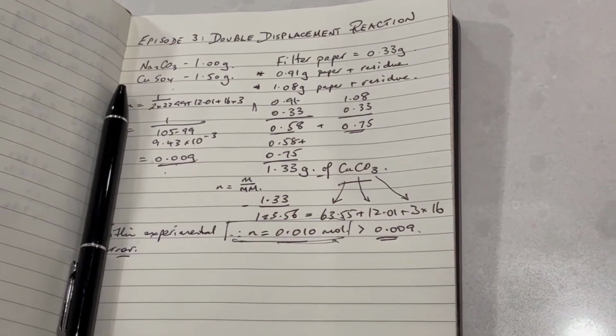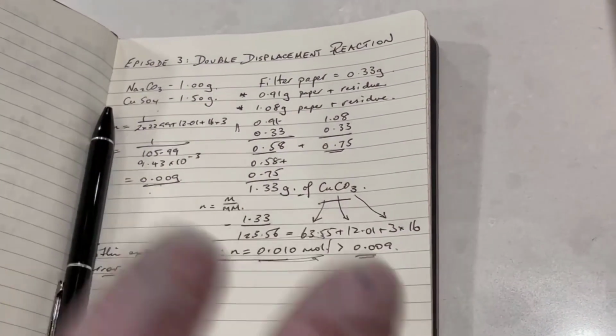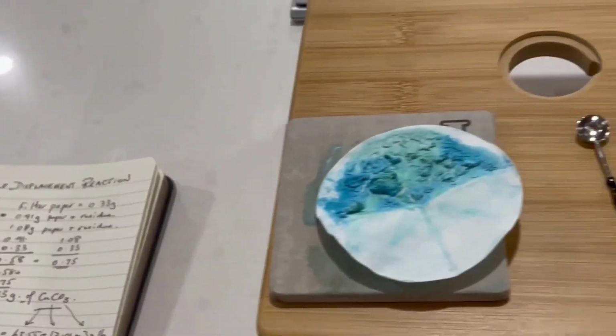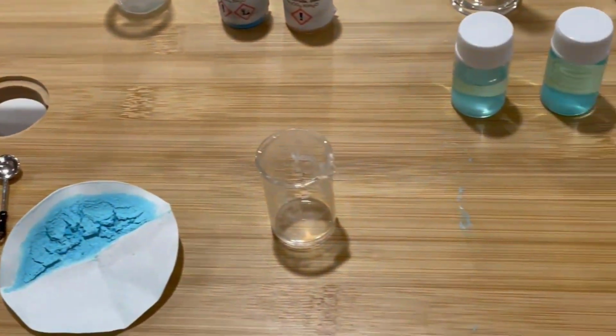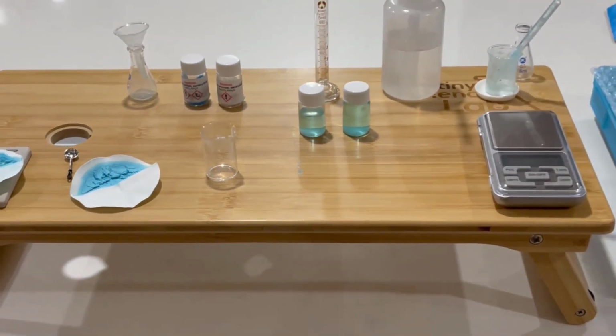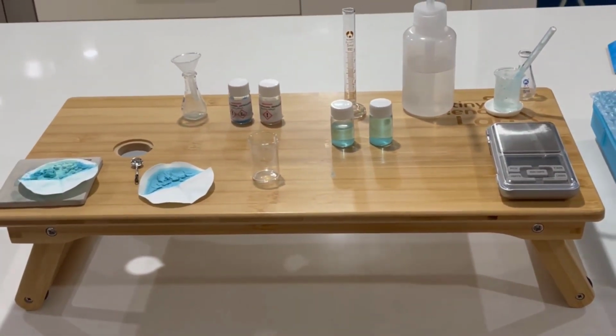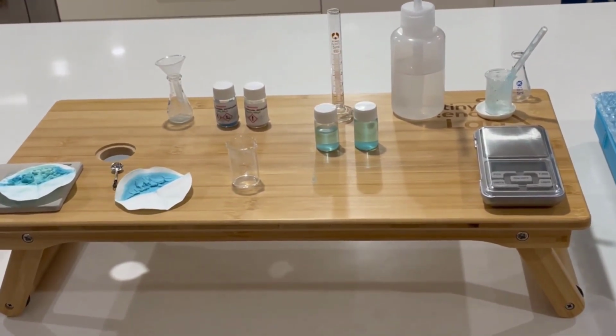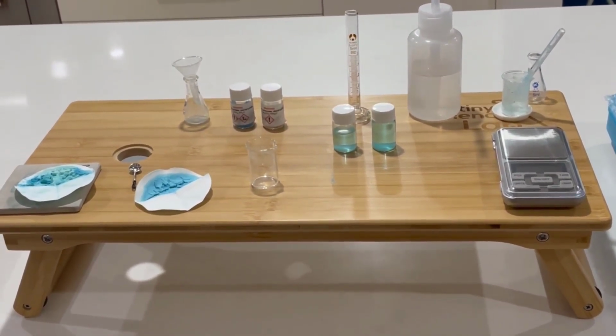So that again could be a source of error. Any residue that you might see on our little working space could also be a potential source of error. And as we've mentioned previously, we're working with very small volumes, very small masses, and so therefore small errors can be magnified when you're only using small quantities. So all things considered, not a bad result.